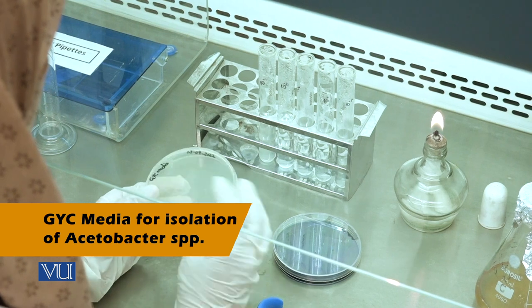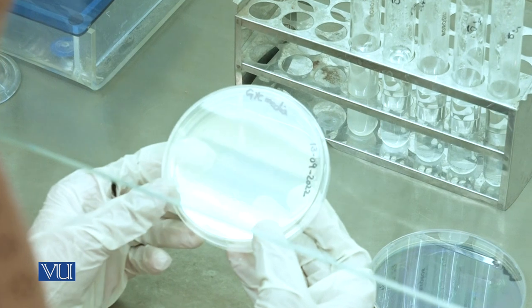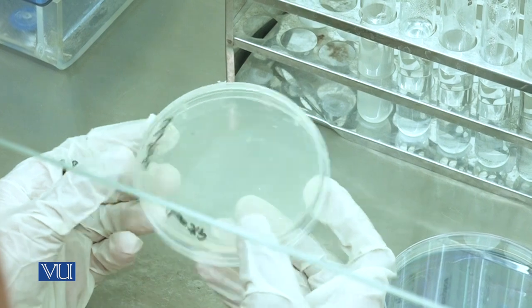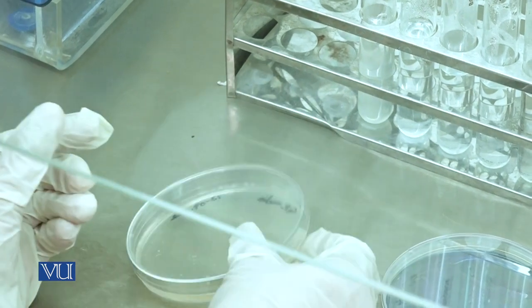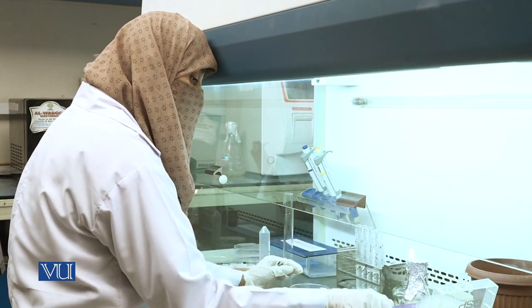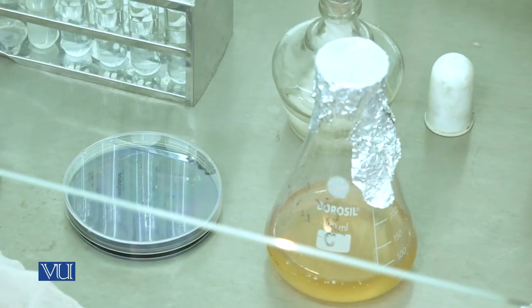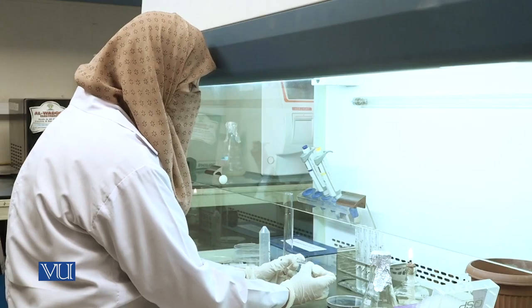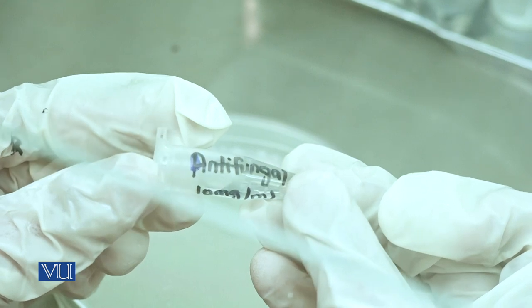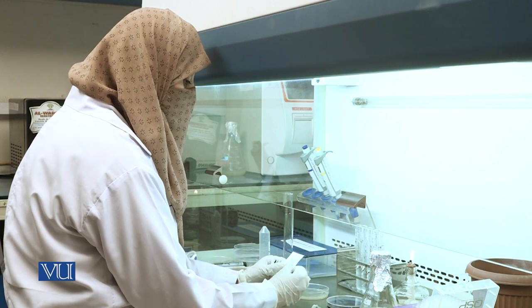Prepare GYC media for the inoculation of grape samples. This is already prepared GYC media. After sterilization of media, add antibiotic. This solution is prepared by measuring according to 10 mg per ml solution for addition of antibiotic.